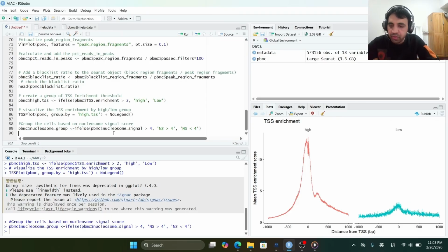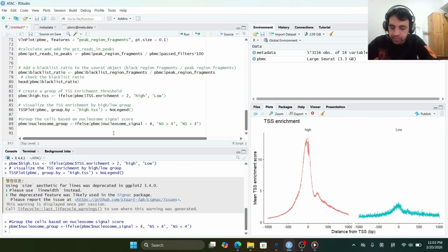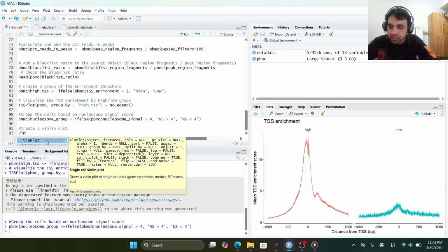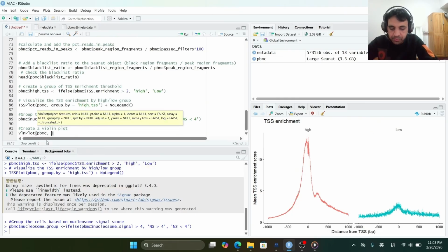And finally, we will visualize all the quality metrics by a violin plot. So now we will create a violin plot by using the violin function from the Seurat package, with the features, and then we will pass all the metrics one by one.